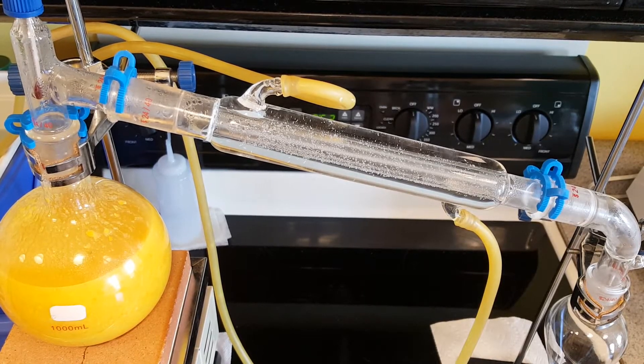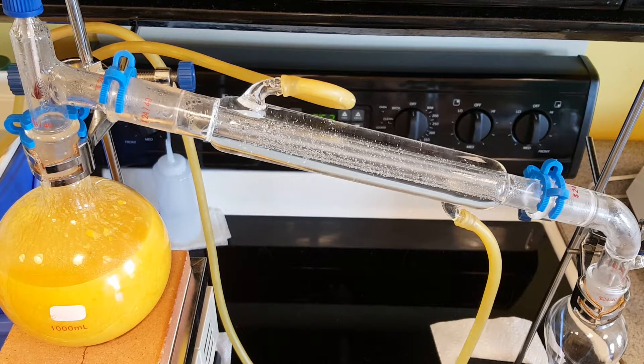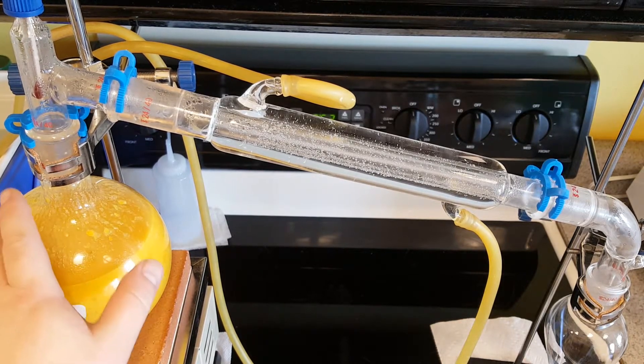Welcome to day two of making the orange aromatic oil. I have the second batch in my boiling flask.